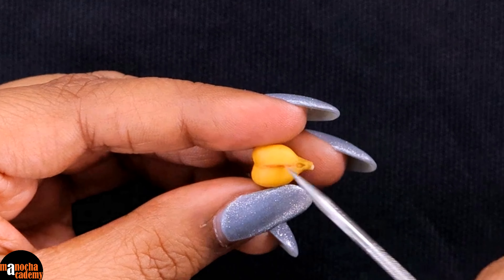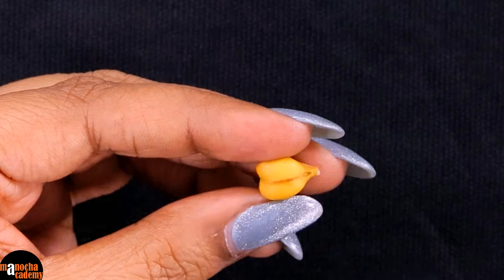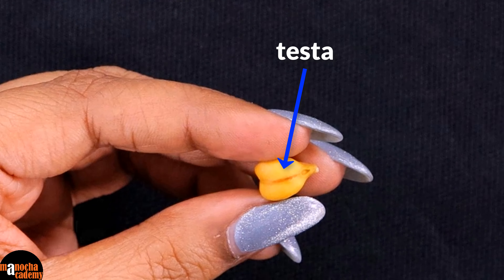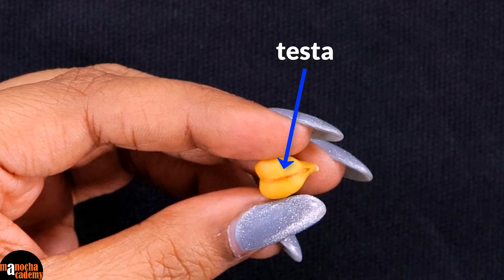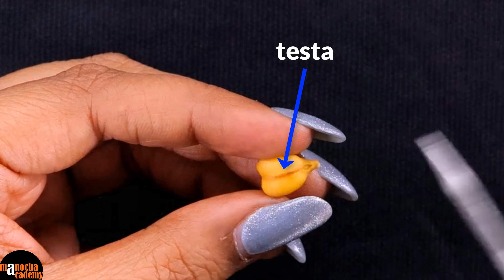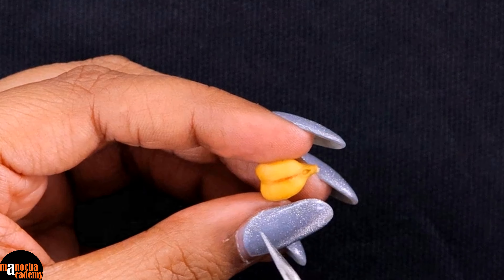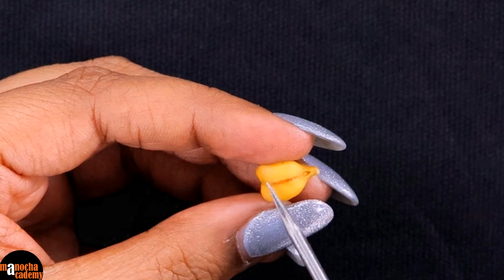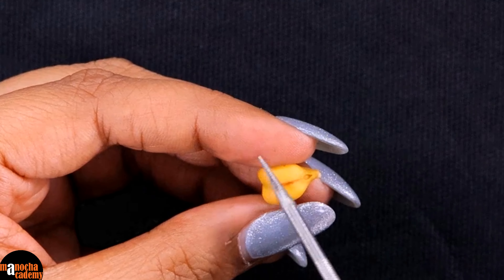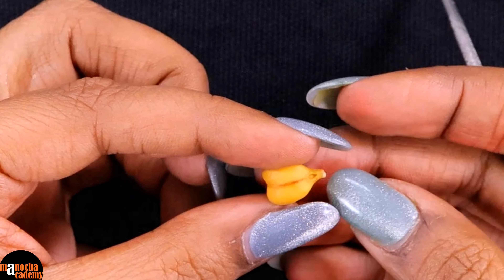The seed is covered with this tough brown covering which is known as the testa. The testa and the tegmen make up the seed coat. I am first going to take out this outer layer which is known as the testa.